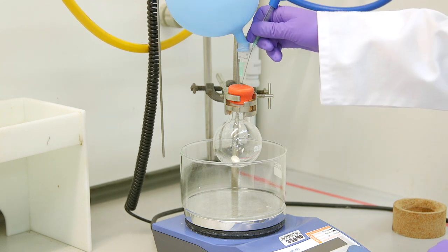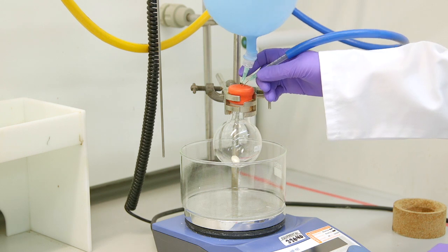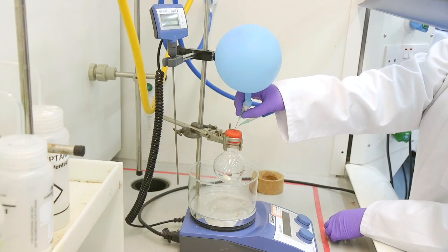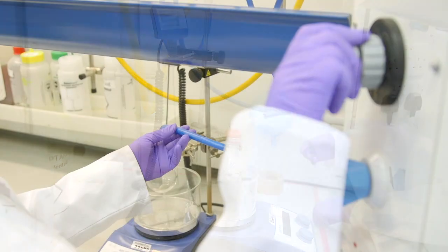To remove the atmosphere from inside the flask, we are going to attach a vacuum line. This will evacuate the air from the flask. The vacuum line only needs to stay connected for 30 seconds.